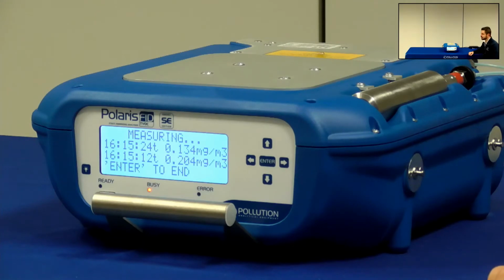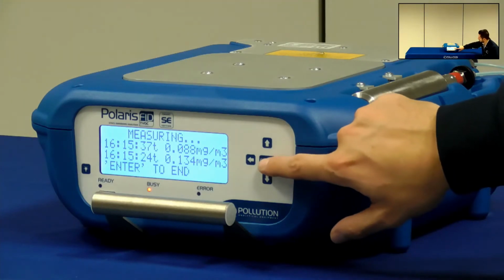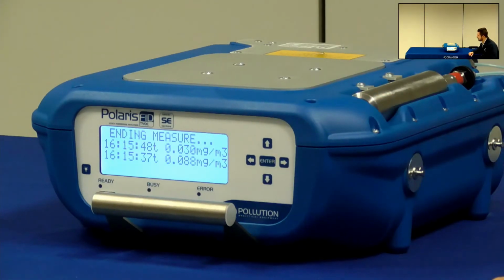just by pressing Enter again and going back to the method menu. If I'm satisfied with the zero value, I can then proceed with the analysis. Otherwise, I need to adjust it and modify the baseline. So here I just waited enough time and I can press Enter and go back.